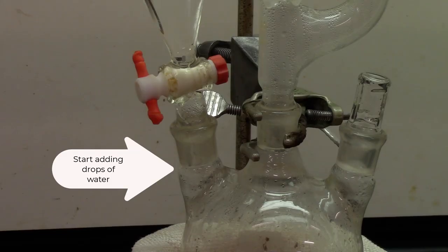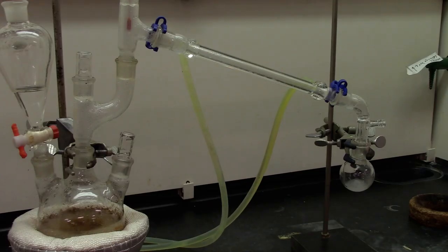Once the distillation starts, go ahead and turn on the separatory funnel and let the water drip into the round bottom flask.